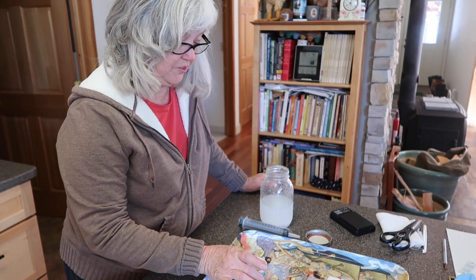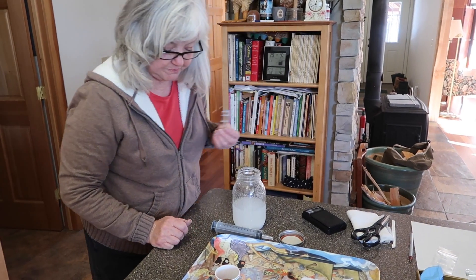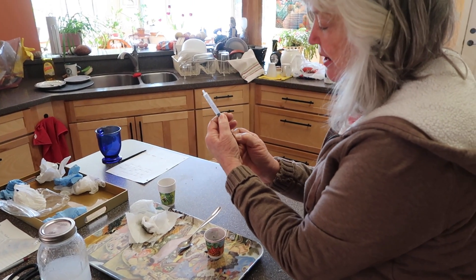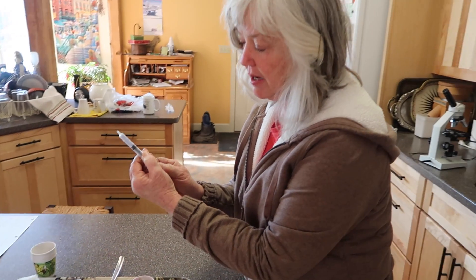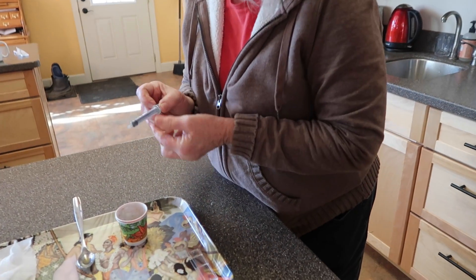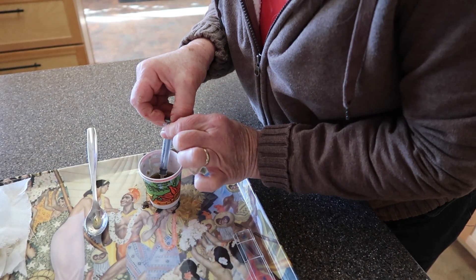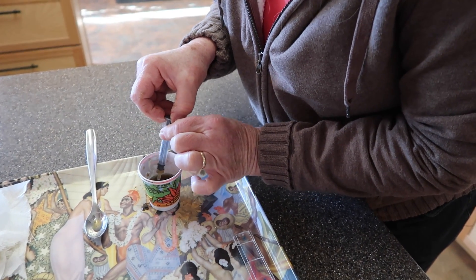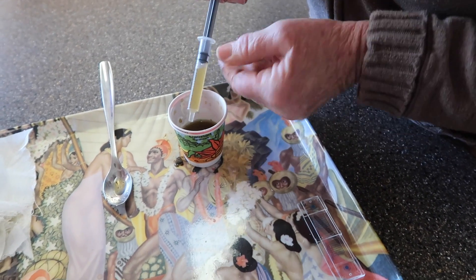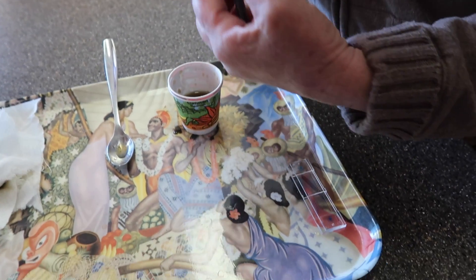The next thing we're going to do is put that on our slide. We draw about two cc's of this — this is a three cc syringe so it's convenient. We're going to get about that much of this and load it into the McMaster's. First, get your target where you're going to go to. I'm going to go on the top because theoretically they're floating on the top. I just gather some sample — I got a little too much so I go back to two cc's.